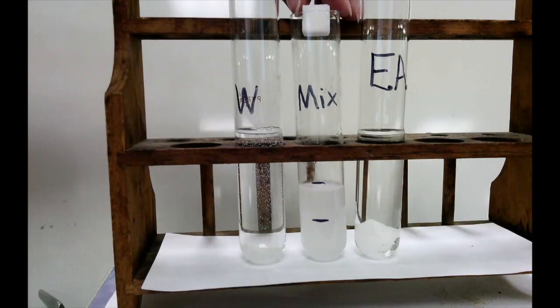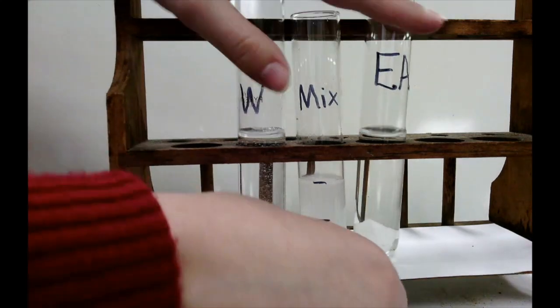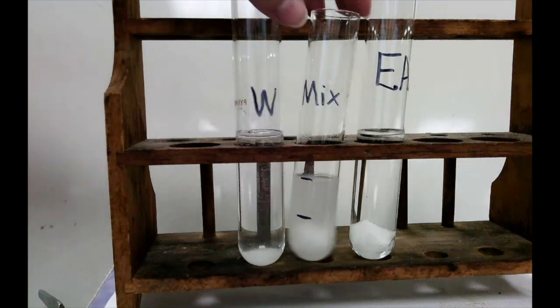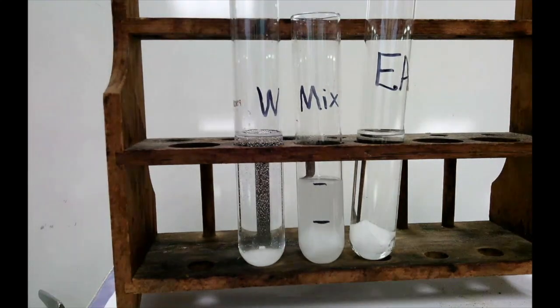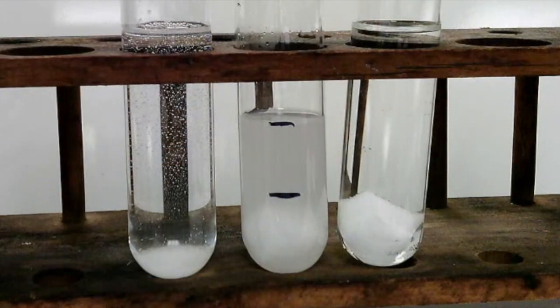The last thing we have to do is test for the solubility of sugar in our mixture here. I've dropped a sugar cube into our mixture. It's a little bit hard to see because of the cloudiness, but we're going to zoom in and see what we can manage to observe. Again, we've sped up the film here to about 8 times speed.